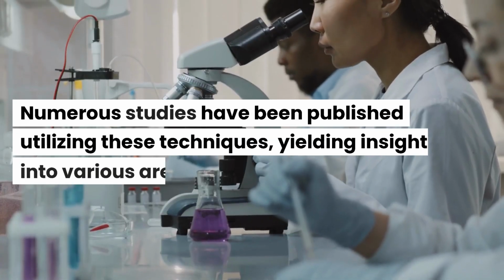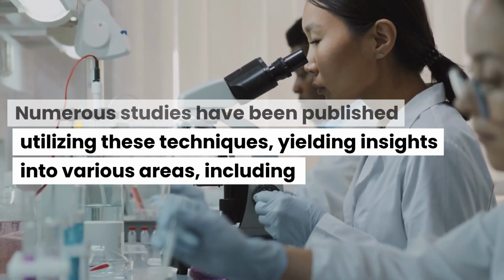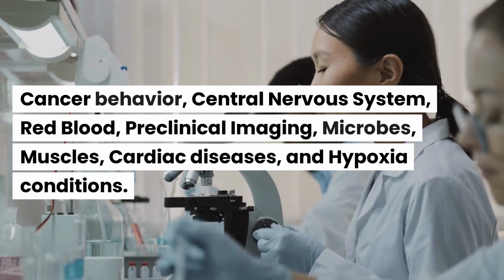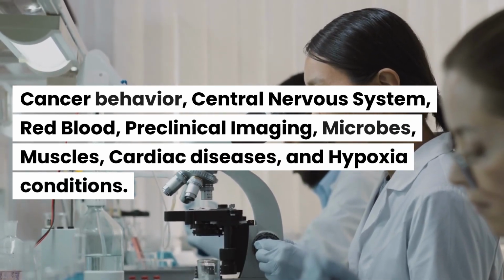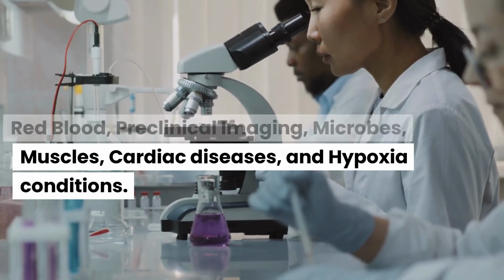Numerous studies have been published utilizing these techniques, yielding insights into various areas, including cancer behavior, central nervous system, red blood, preclinical imaging, microbes, muscles, cardiac diseases, and hypoxia conditions.